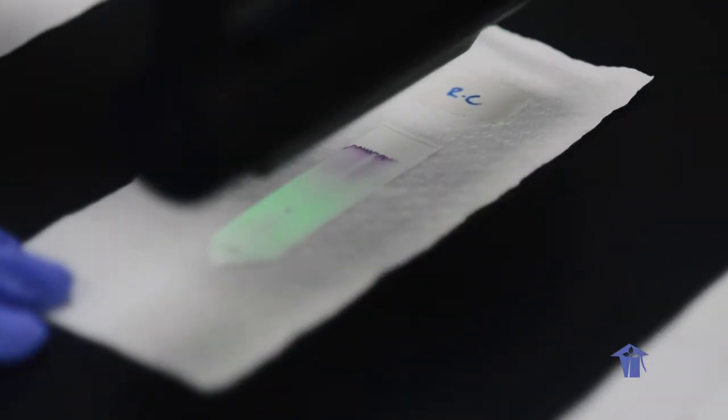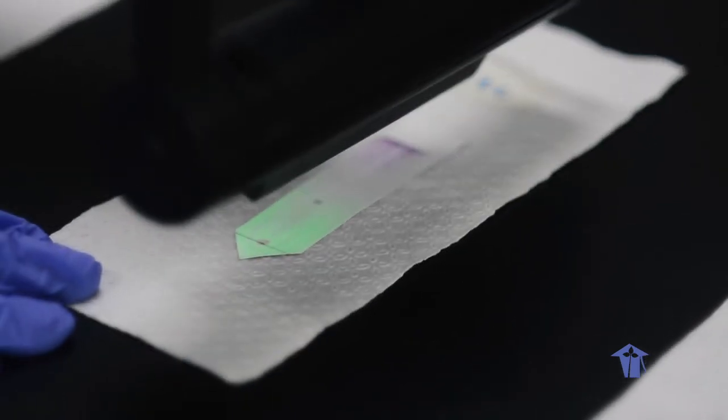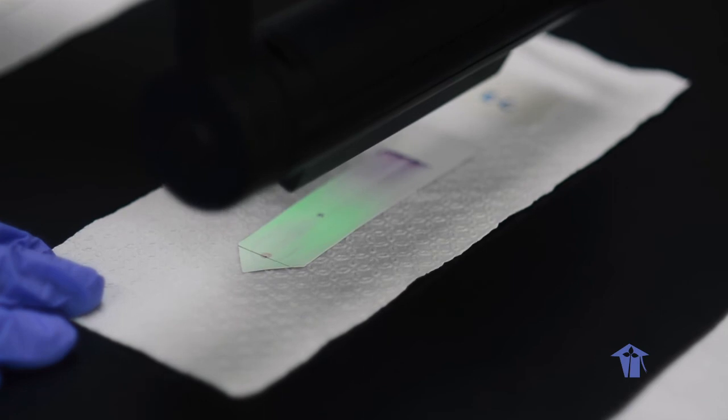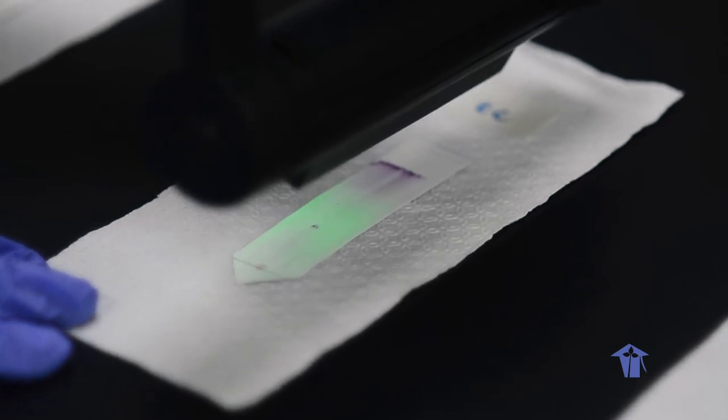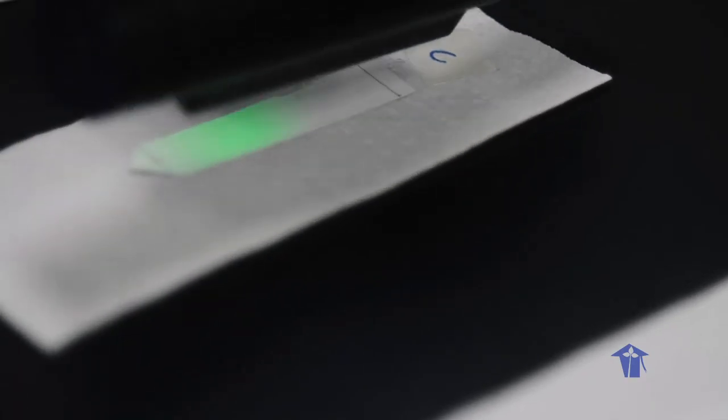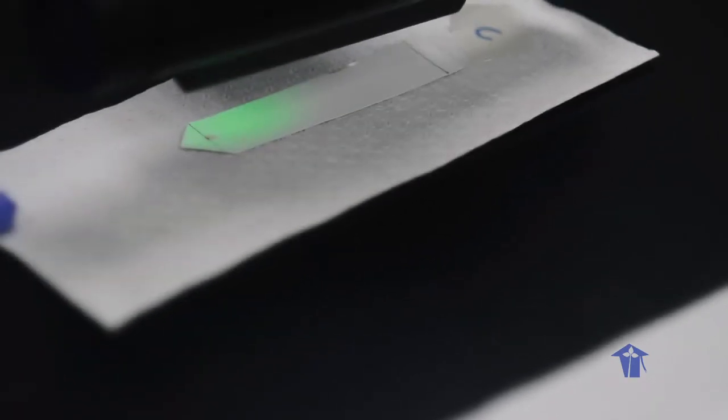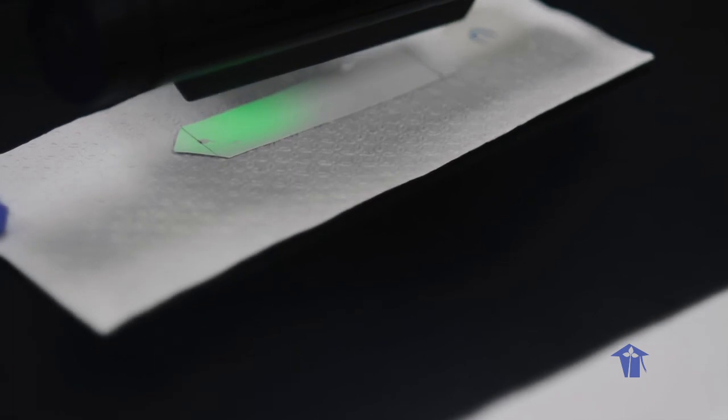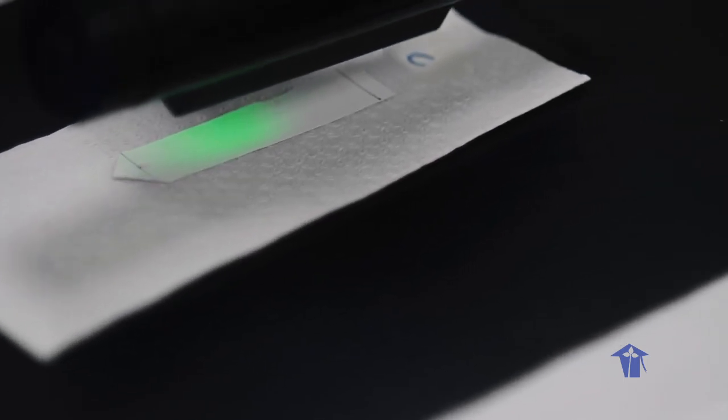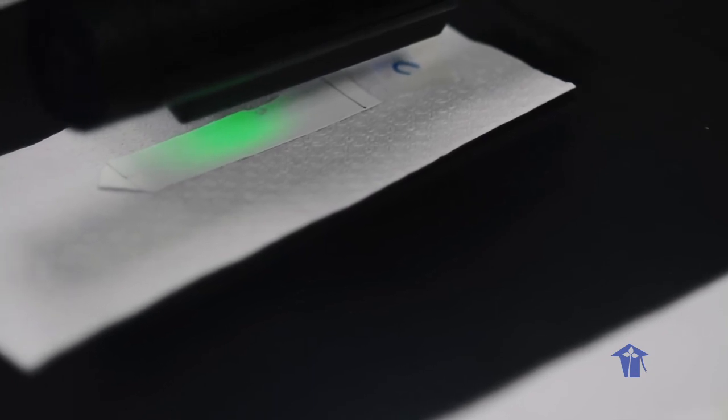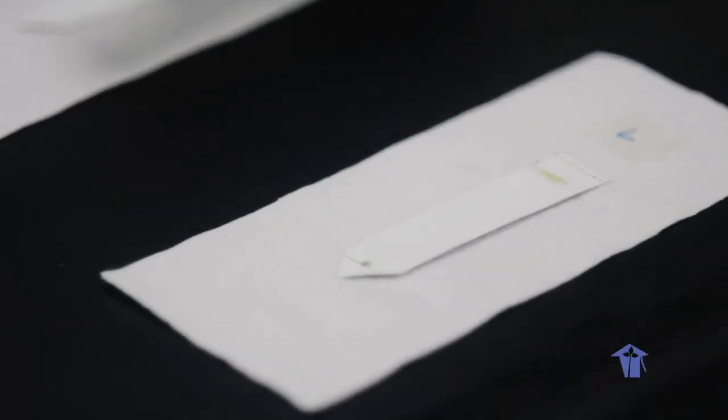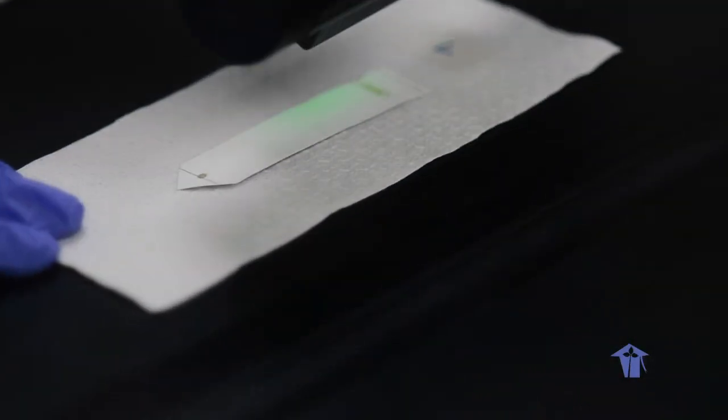And then we have the sample from the red cabbage. This one is from ordinary cabbage.